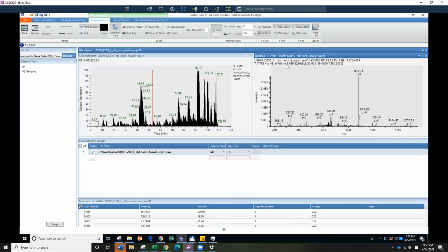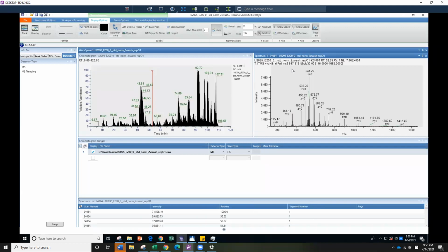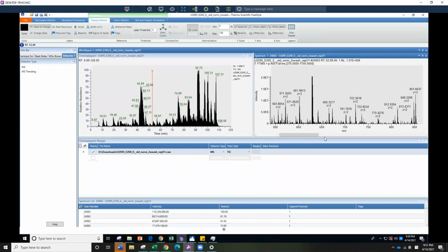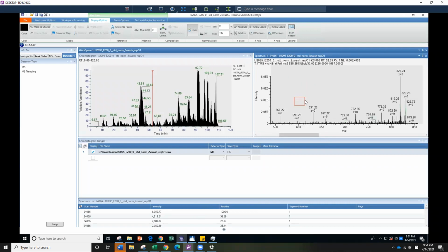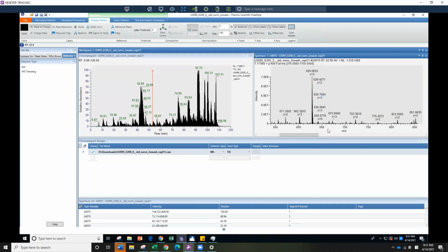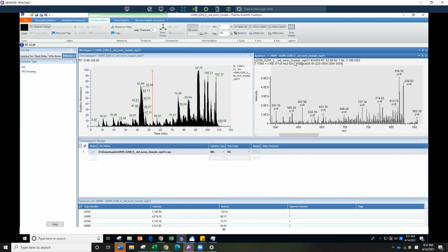Okay, so that is an MS2 spectrum, and the precursor is 669. If you go back to the MS1, 669 is here somewhere. You have to zoom in. Or maybe it is the MS1 after. Let's see. It's interesting. But anyway, it tells you that is your precursor mass, and from that precursor, you fragment it and you get this MS2. So this is just explaining what you're looking at here.